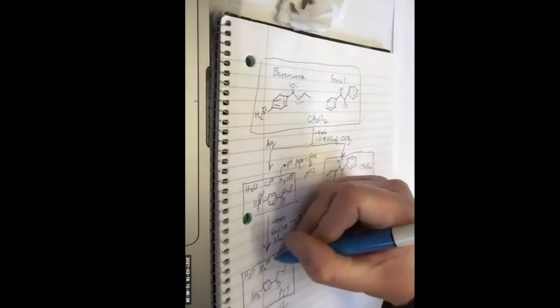And then, at this point, what molecule is most present? By far most present? Water. Okay, and what about some ions? Sodium, chloride. Sodium, chloride, good. What else? Is there much hydronium left? There's almost no hydronium left. Hydroxide is what I'll put. I'm just drawing my major species. The hydronium concentration is super low when you're at a pH of 12 or around there. Okay, so that's my first precipitate.